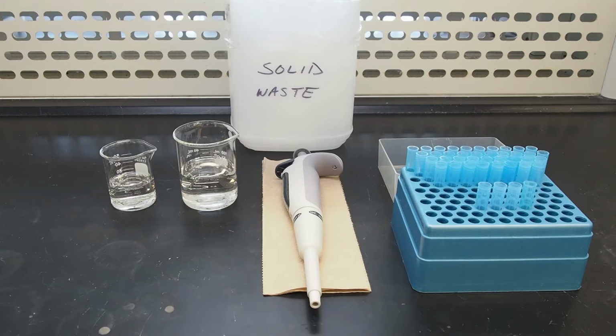Because of this diversity, it is always important to read the specific instruction manual that came with your pipette of choice so that you know how the manufacturer intended it to be operated. Despite the variety of different micropipettes, there are general core practices that contribute to proper pipette etiquette for accurate transfers, and this is what we'll be covering today.